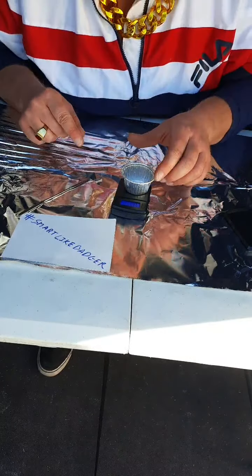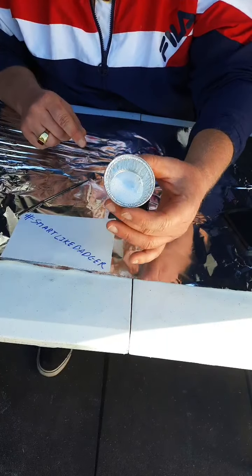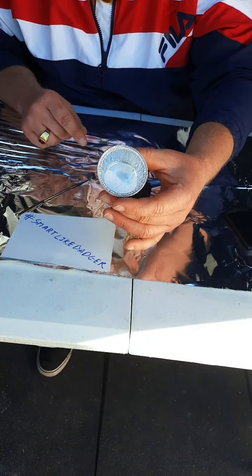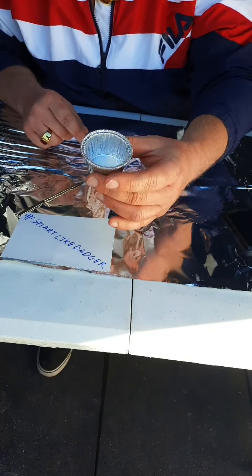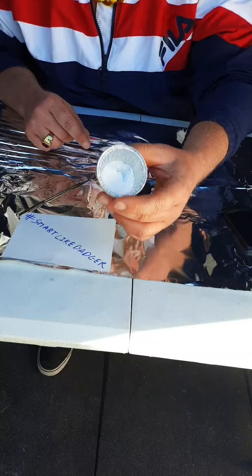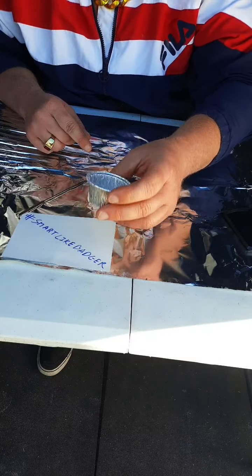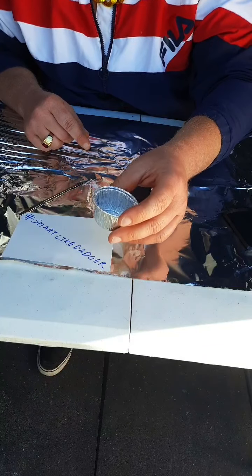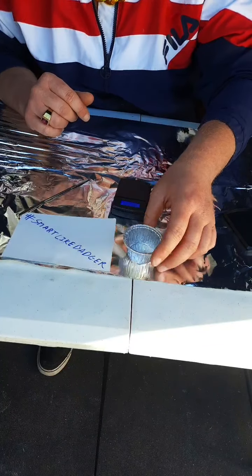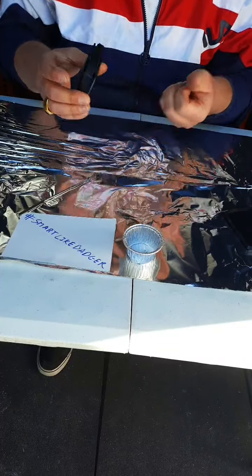Now, we know initial. We must take note of how it looks because its physical change that we observe will be telling us about the progress of the reaction. So if we note these are very uniform spheres, they look like they were done in a manufacturing plant. This isn't like a raw mined material out of Soviet Russia. It looks very American produced. We will heat this and observe the changes. We will heat for 5 minutes and see what happens after 5 minutes.